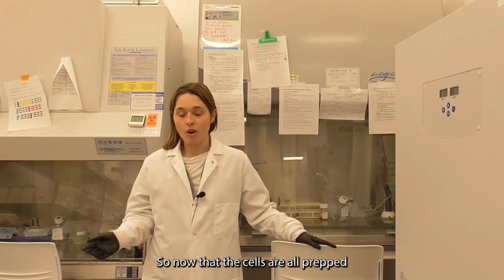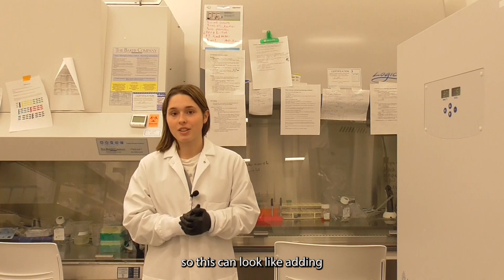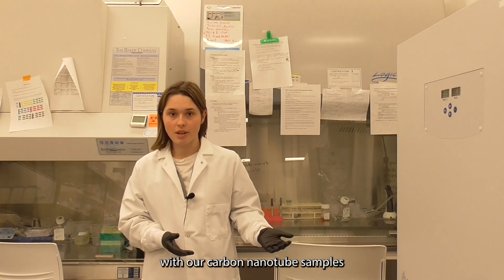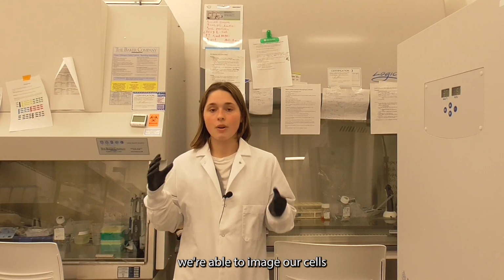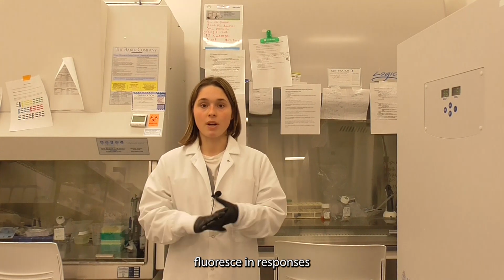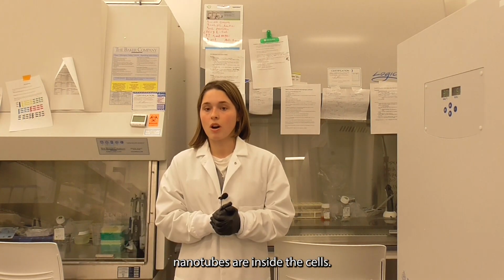So now that the cells are all prepped and ready, we're able to run our experiments on them. So this can look like adding or dosing the cells with our carbon nanotube samples. We're able to image our cells with the nanotubes inside and see the nanotubes fluoresce in response to different environments, or just over time to see where the nanotubes are inside the cells.